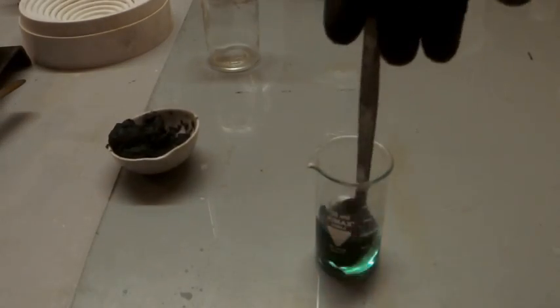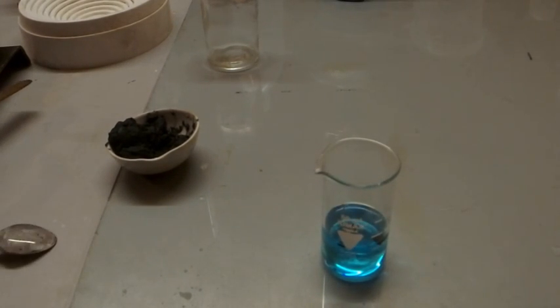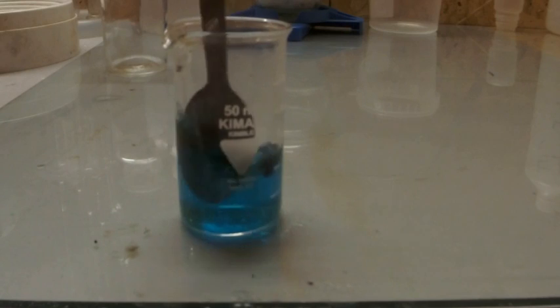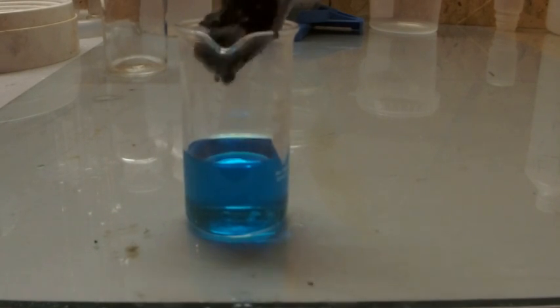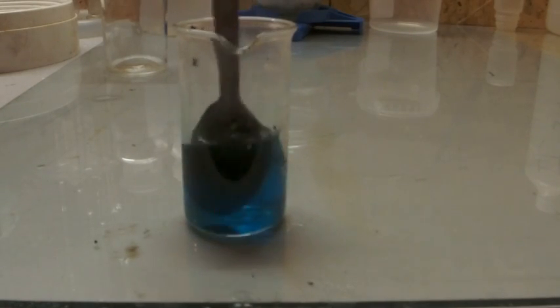To get the nitrate simply dissolve the hydroxide in some nitric acid. And here is the clue of this whole process: as you can see there are no nitric oxides forming, which saves you a lot of the beloved nitric acid.